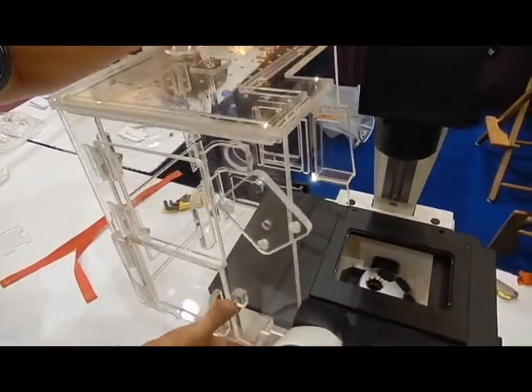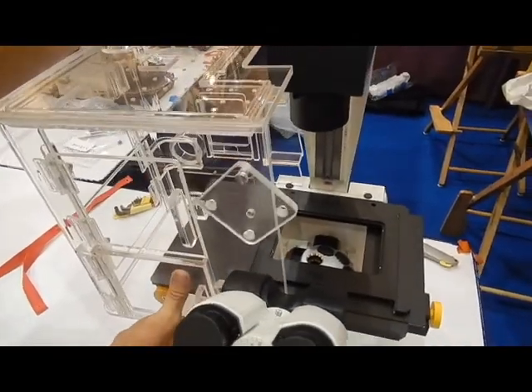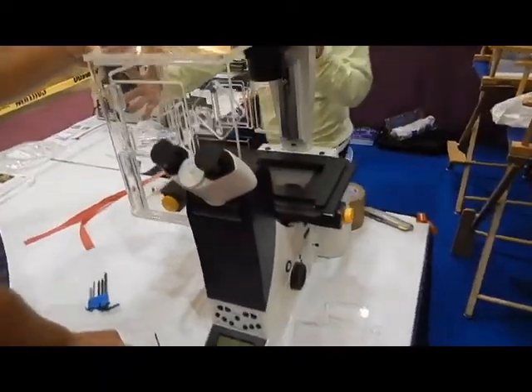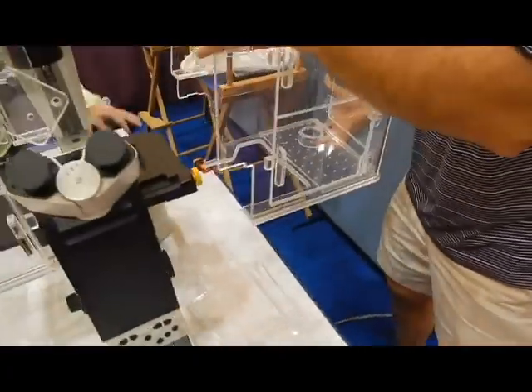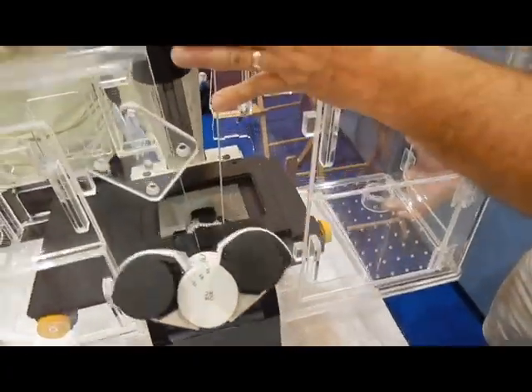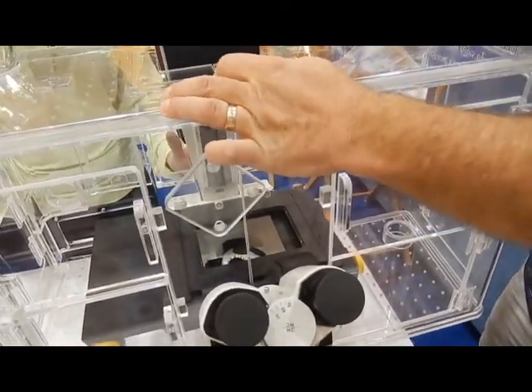Let one person hold the left side in the proper position. If desired, you may remove the bottom panels from the right side of the cage to make it easier to assemble. Slide the right side of the cage into place.